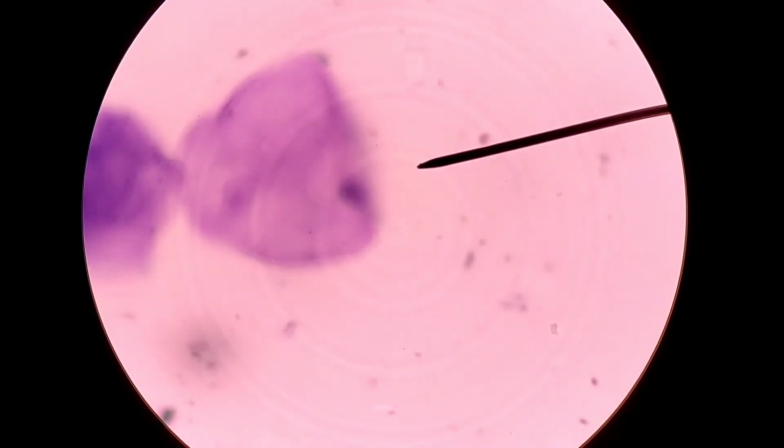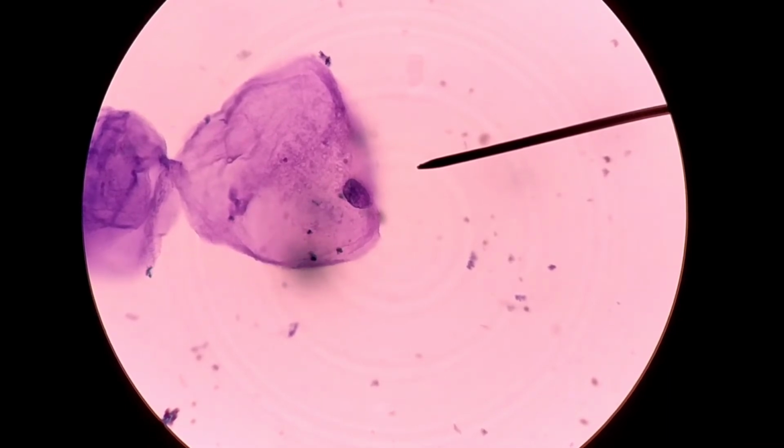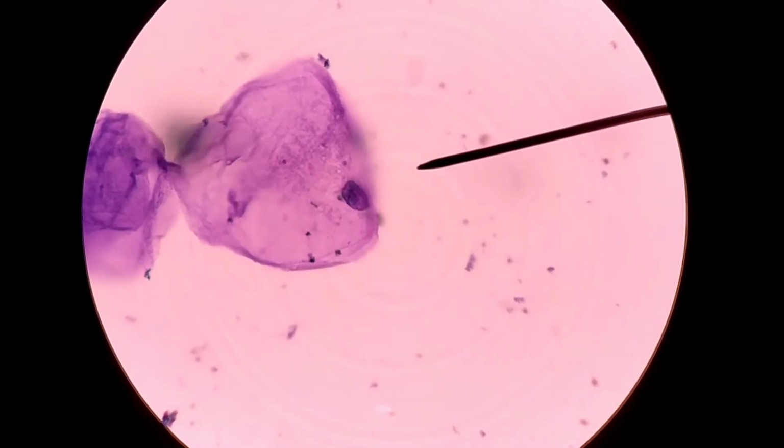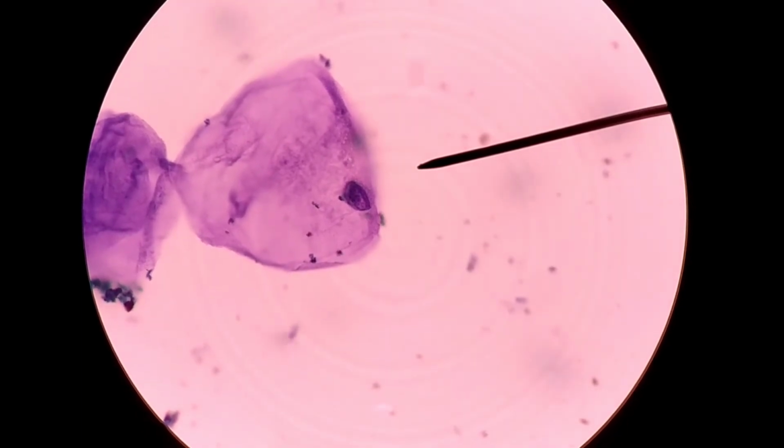And now with just a little bit of fine focusing, we should be able to see the cells. I'm using the fine focus. Beautiful. All right, if I do say so about my cheek cells. Okay, we have a cheek cell in focus, and besides the nucleus, which you can see to the right-hand side of the cheek cell, closest to the pointer, there are some other dark objects on there, and those little dark objects, if I get them in better focus, are bacteria. Bacteria are the smallest, darkest little objects stuck to the cheek cell, and that's completely normal. Everybody's going to have some bacteria stuck to their cheek cells.